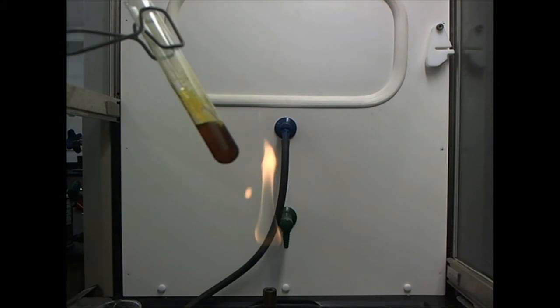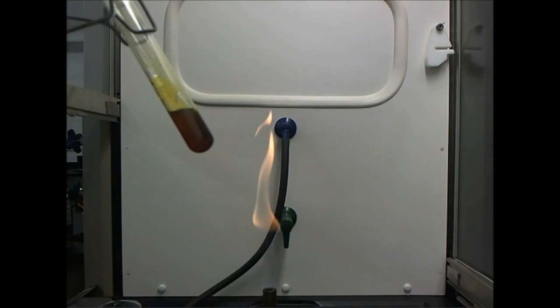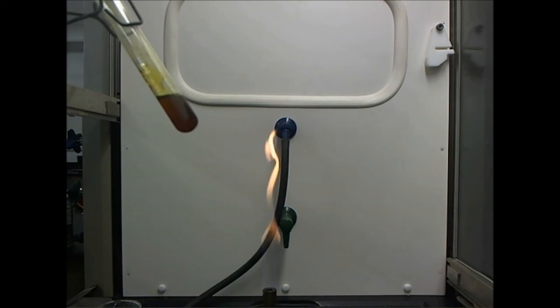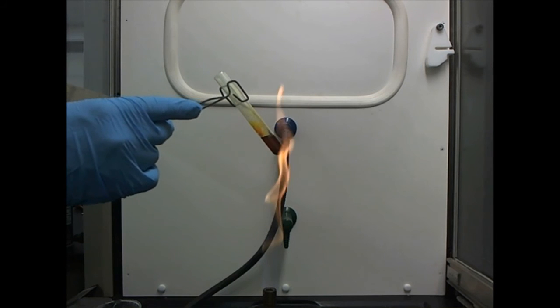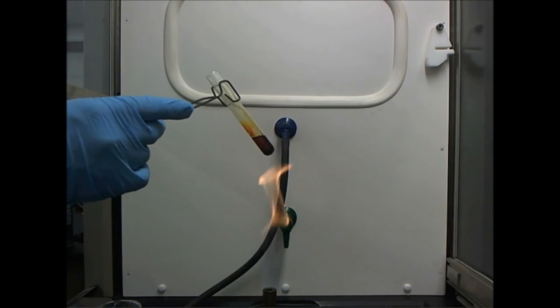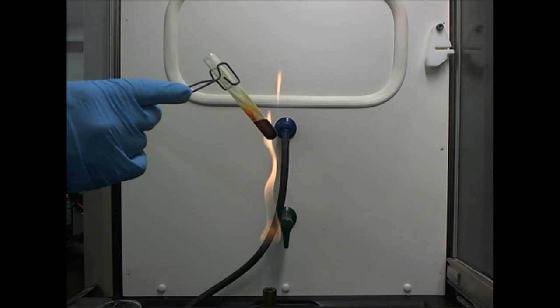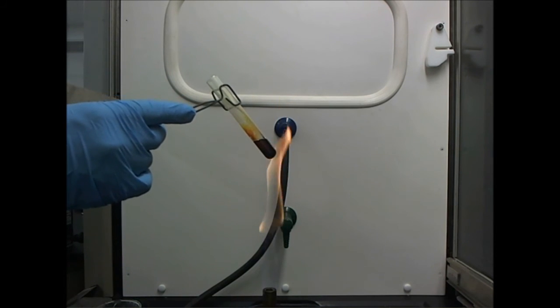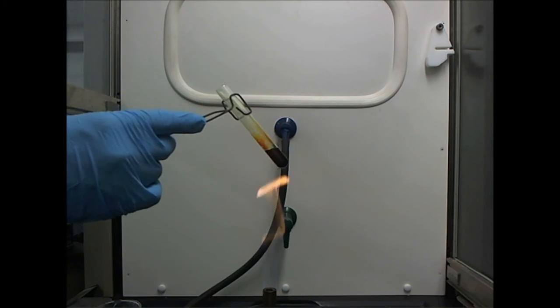I've raised the temperature of these sulfur rings past their melting point. However, this is still comprised mainly of those 8 atom rings. I need to continue heating it further to change it to an entirely different allotrope. As I continue to gently heat the sulfur liquid, I'm adding more and more energy to it. As I do this, the rings are going to start to break open, and it's going to change to a completely different allotrope of sulfur, a different arrangement of the atoms.